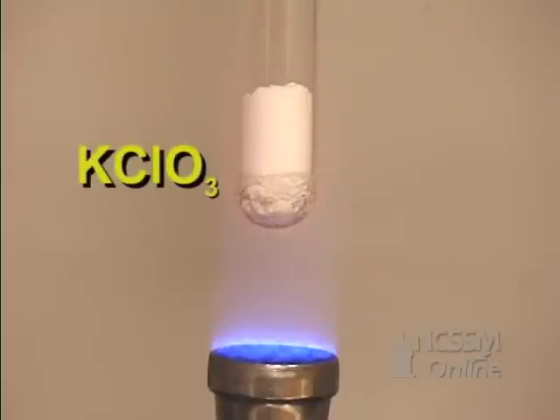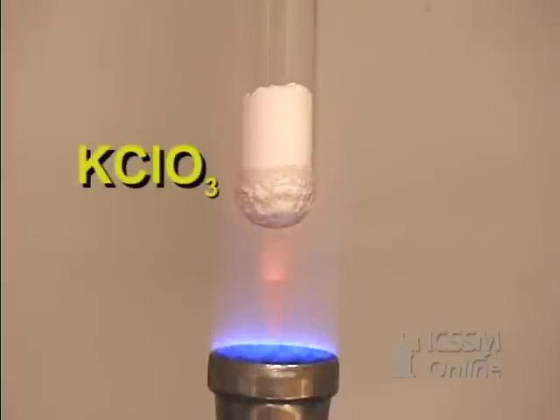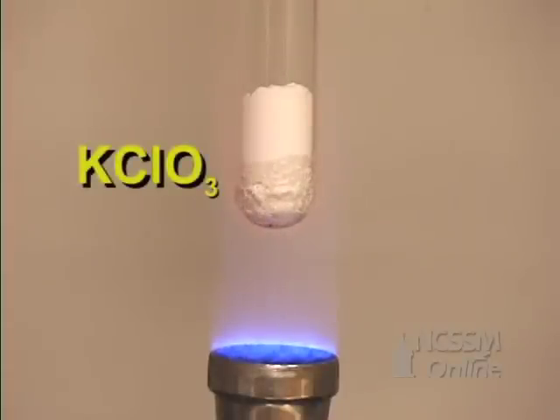Let's do that in the lab at a faster rate than happens in your body. We're going to heat the potassium chlorate.